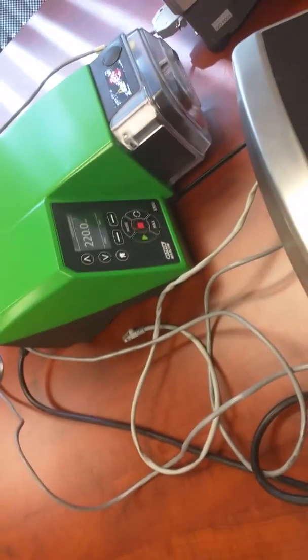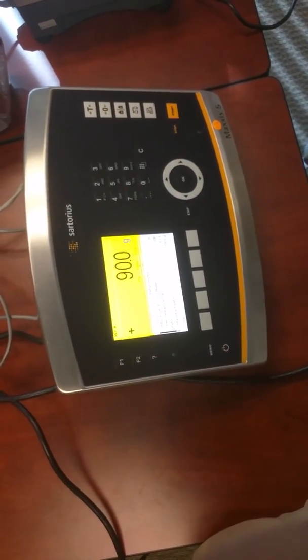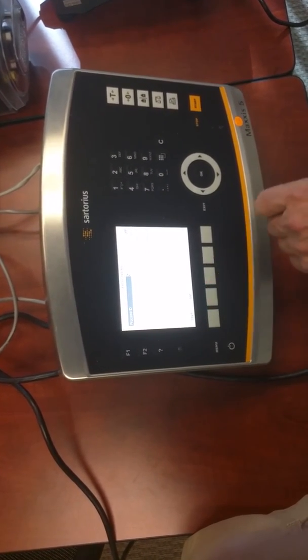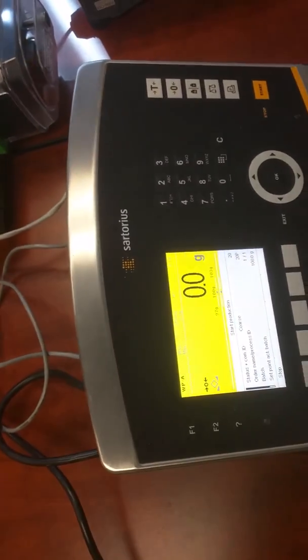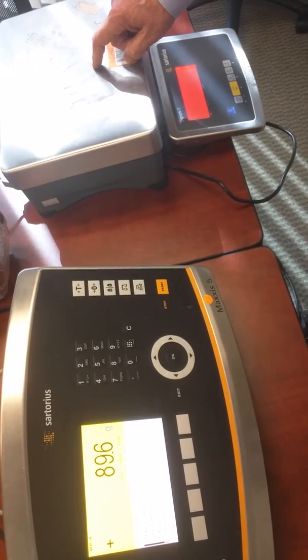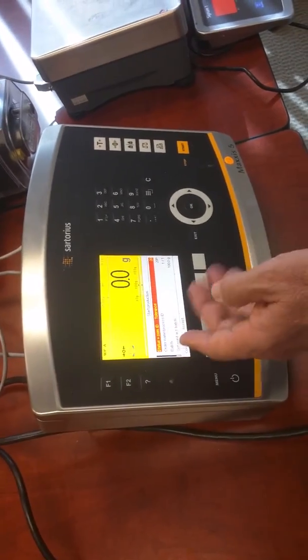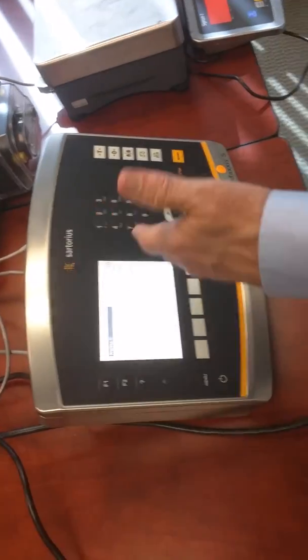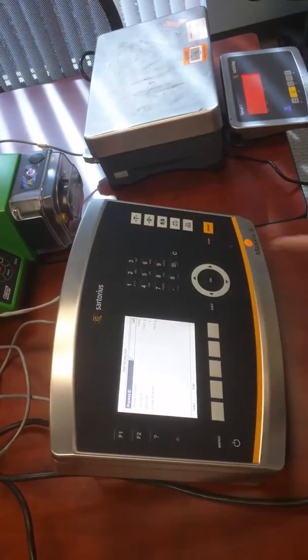the pump's going. It's trying to get to 100 mils. But there's nothing on the scale, so we have to simulate that. Now if we want to start it again, we just hit start. We hit start each time. We can simulate the weight in this case because we don't have anything on there. And then now it went over the tolerance, so I'll just hit accept and it's ready to start again. So I could change the batch, but I'm not going to. This just shows you, you could make that 100.